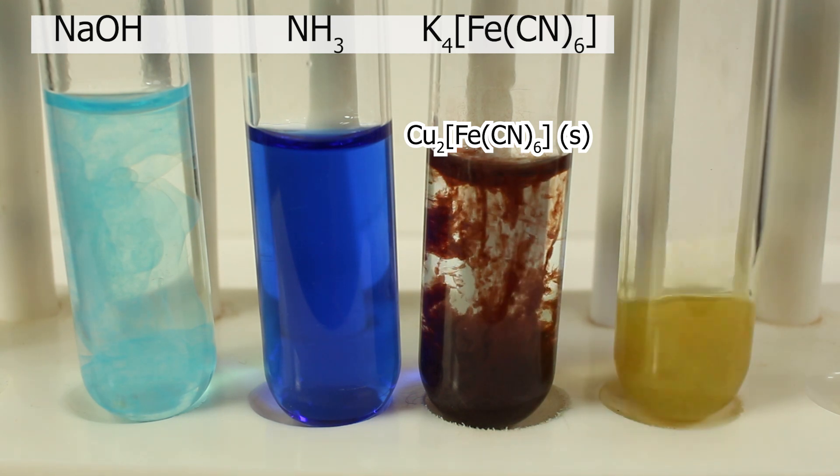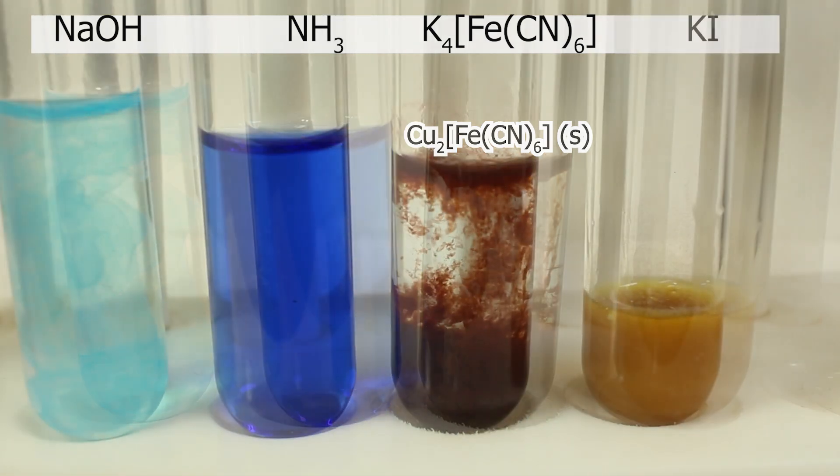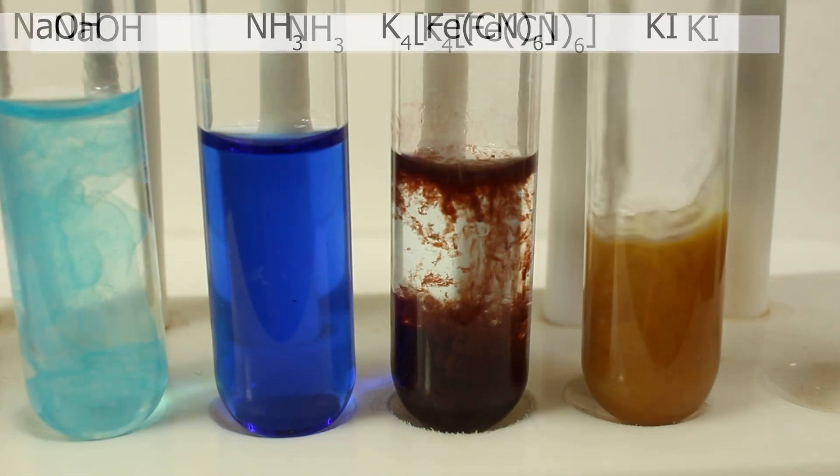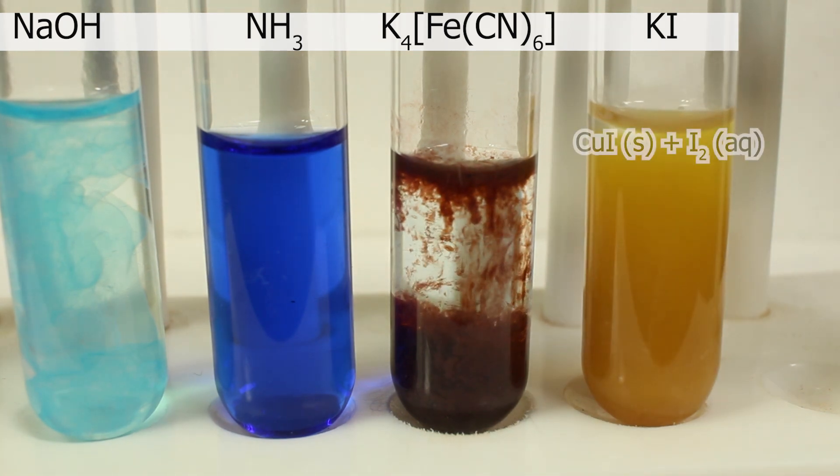And potassium iodide, brown solution with white precipitate of copper I iodide. Brown color is due to iodine presence.